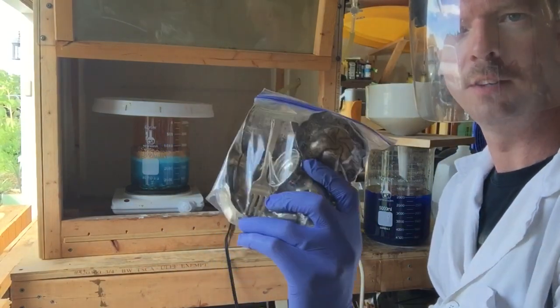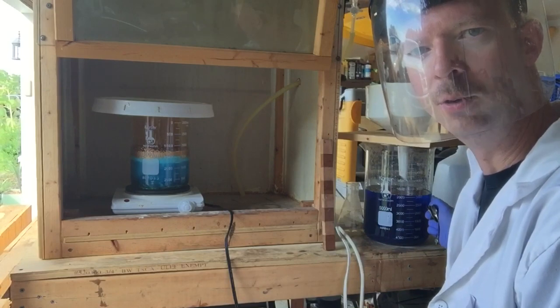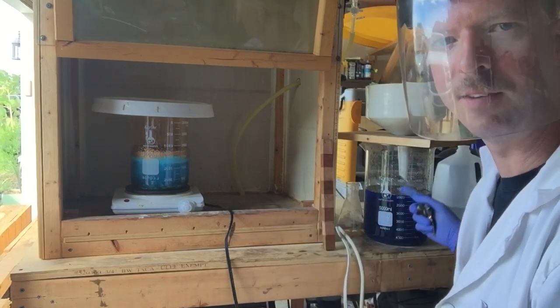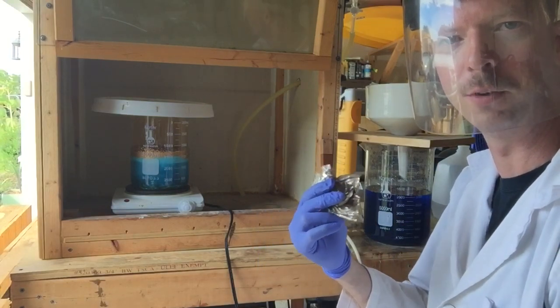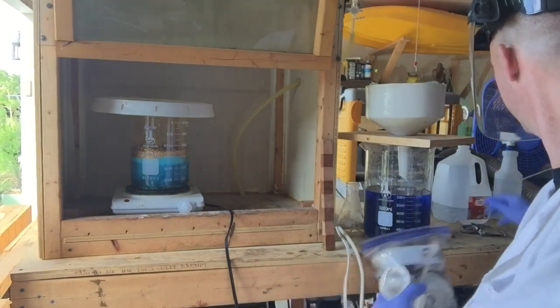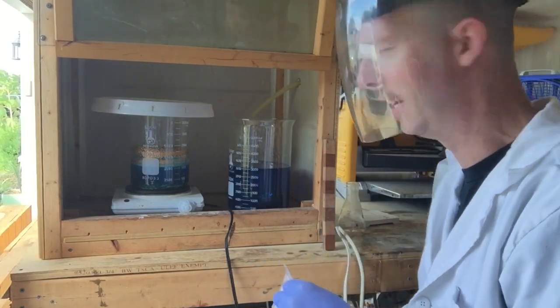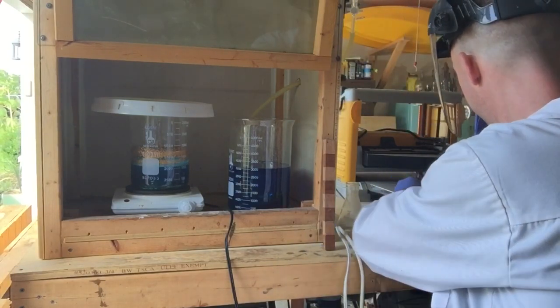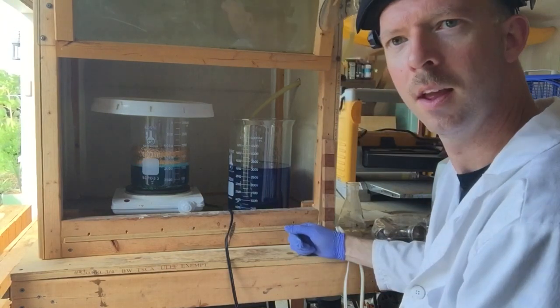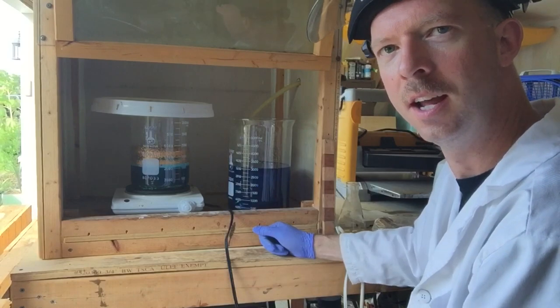As a little bonus in the video: I've used a lot of nitric acid and I still have a lot of nitric in this beaker. I've got some silver I've been wanting to refine — a lot of junk silver. What I'm going to do is throw it into here and use up the excess nitric acid. There's probably a little bit of silver in the pins in there too but it won't be much. I'm going to stick this into my fume hood and start adding the silver. Hopefully there's a little bit of excess nitric in there and it starts to dissolve the silver. I'll leave this until we wait for our new nitric to get here.